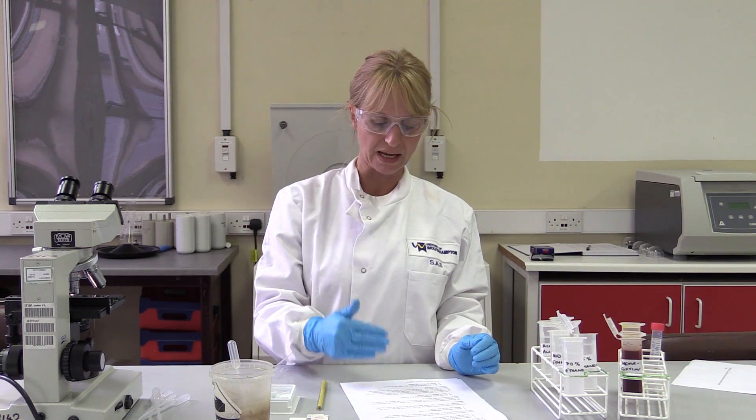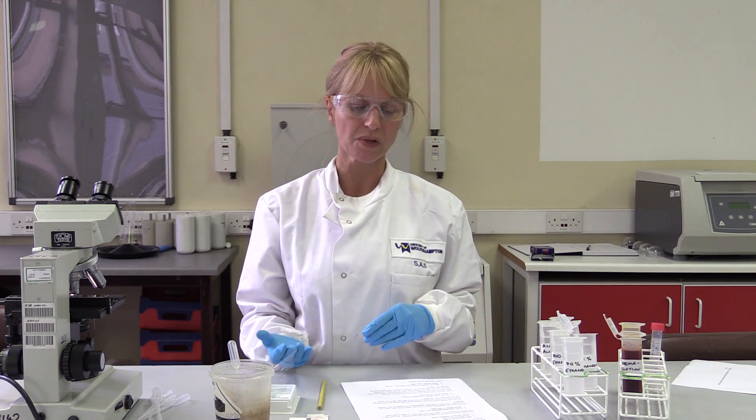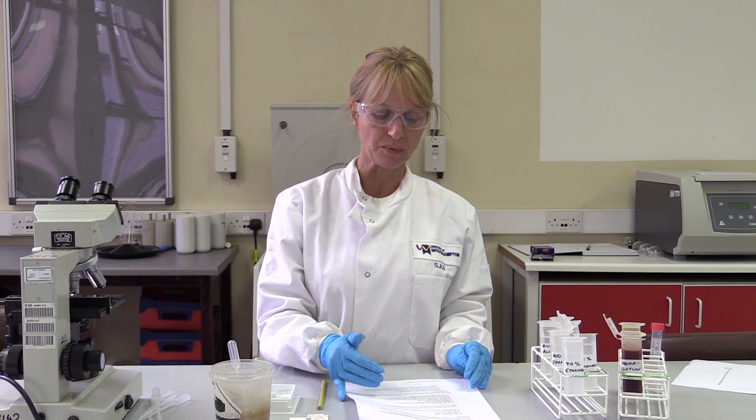Continue taking your slide through the staining process. At each stage, every time you've completed the next step and the booklet tells you to make a note, record what you actually see down the microscope — not what a book tells you, but what you're seeing. What do the cells look like? What colour are they? What's happened between each stage of the staining? Take it through until the end, where you dehydrate the slide, remove the water, and mount it with a cover slip.